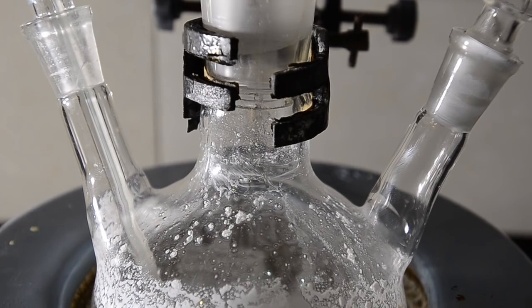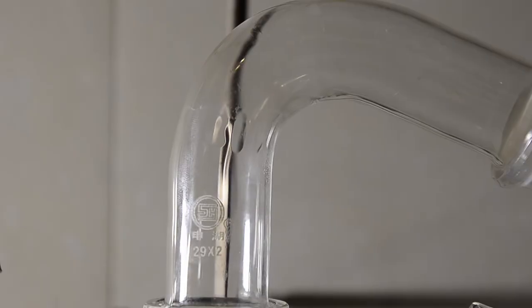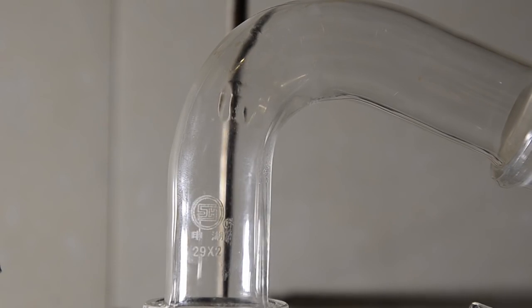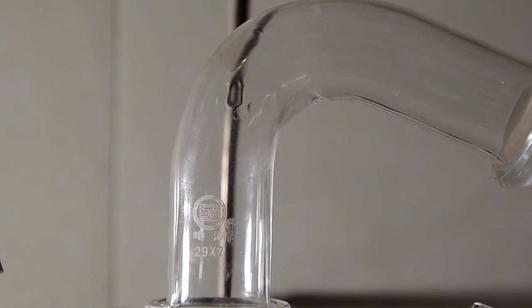Pretty soon a strong distillation starts and a solvent front creeps up the adapter tube. It's always very satisfying to watch this.